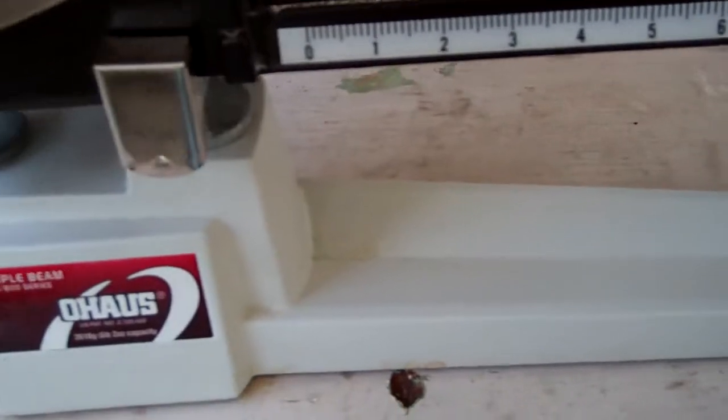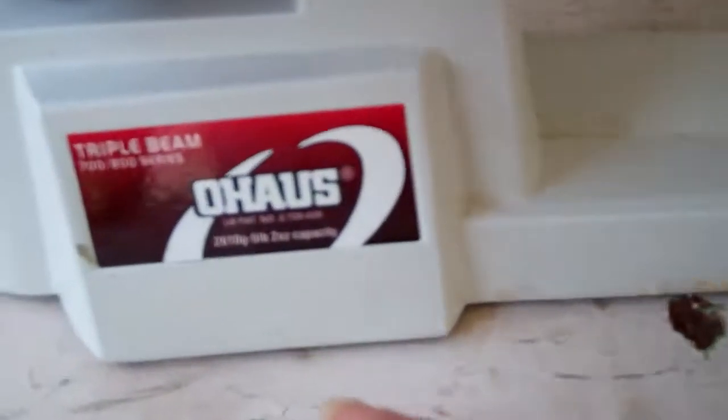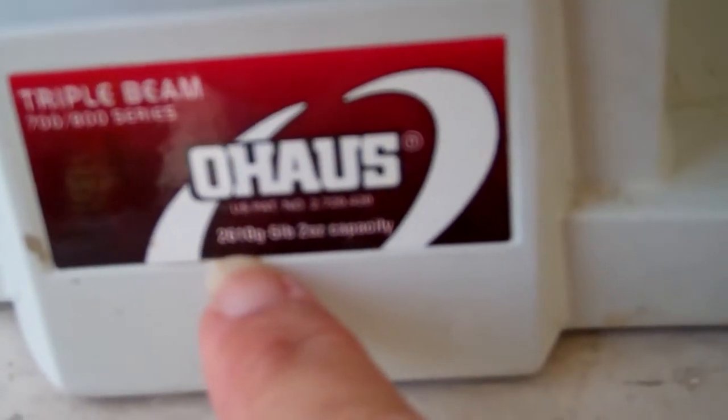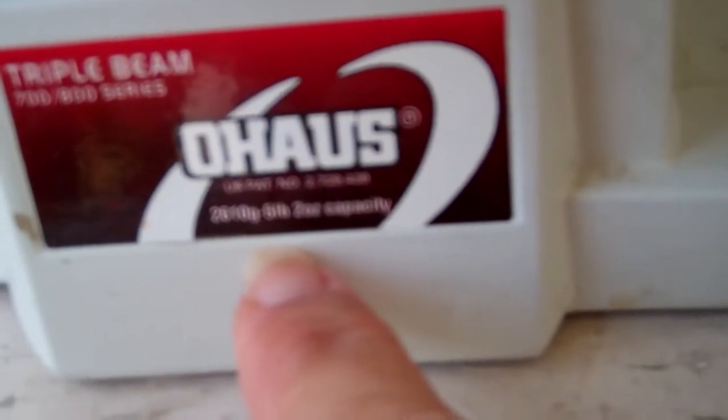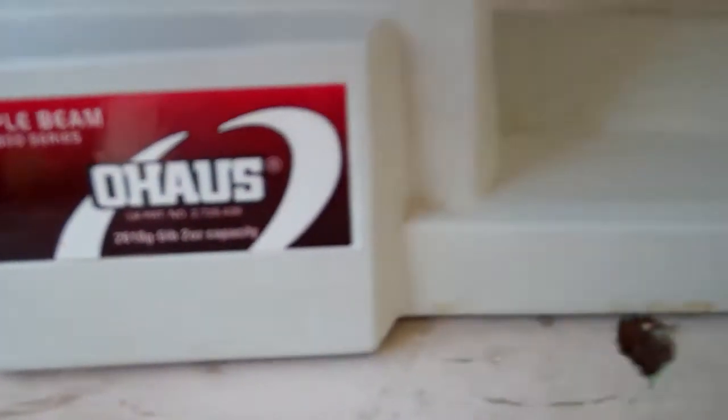And what that tells you is that this object is too heavy for this triple beam balance. There's a capacity. It tells you right down here what the capacity is. How much it can hold. The maximum.